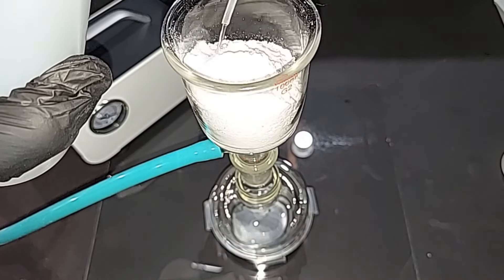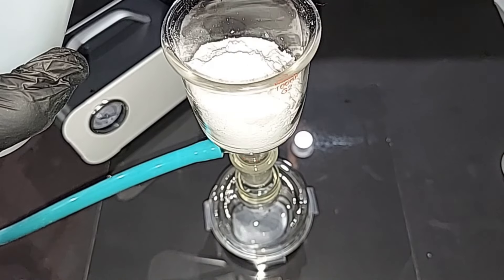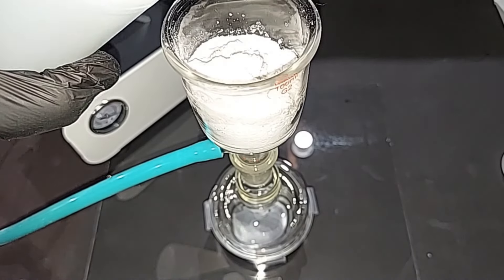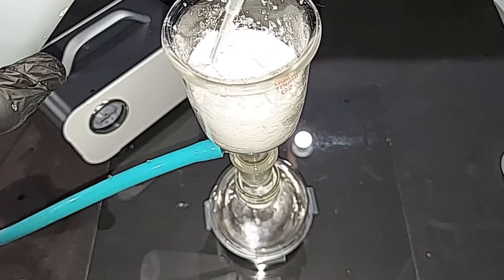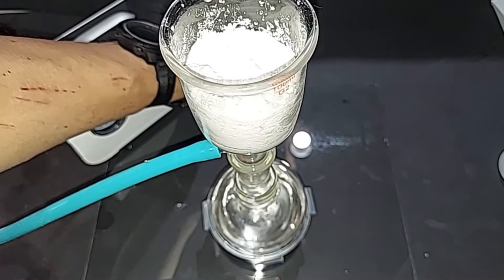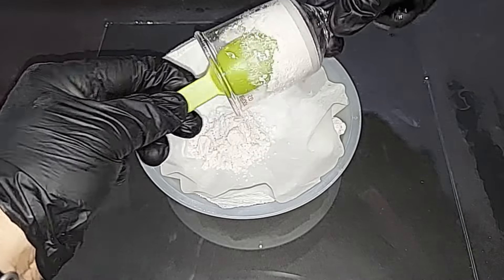Because we used extra ammonium nitrate, which is soluble in acetone, that should wash out. There shouldn't be any sodium hydroxide in here, and the sodium nitrate itself is insoluble in acetone. I think that's more than good enough — I'll stop this and take it apart. I'm going to scrape out our wet sodium nitrate, which is already drying up; I don't want it to dry too much and turn into a block.